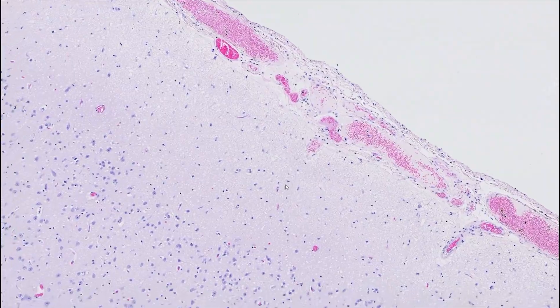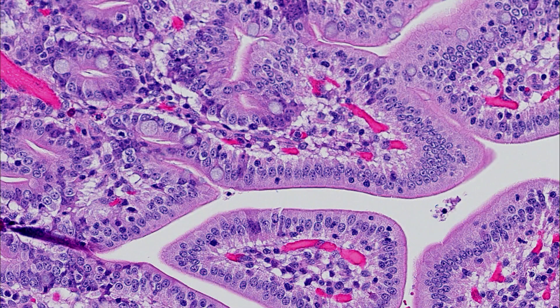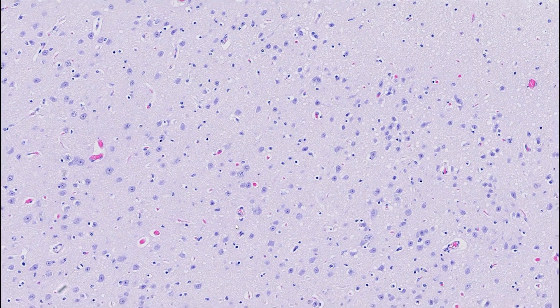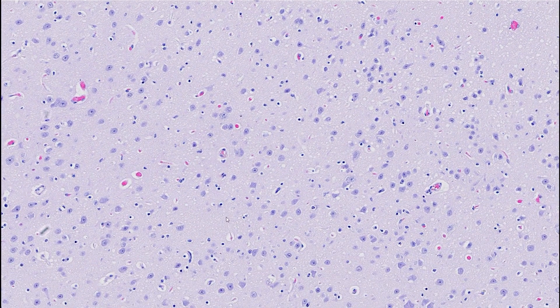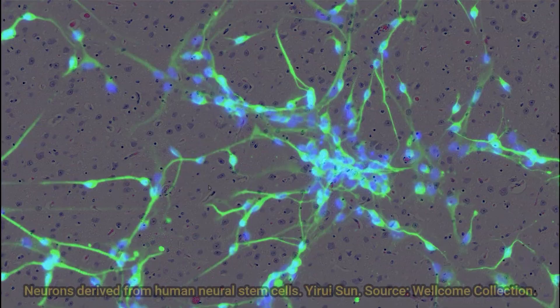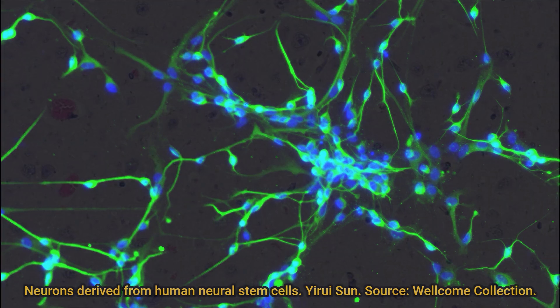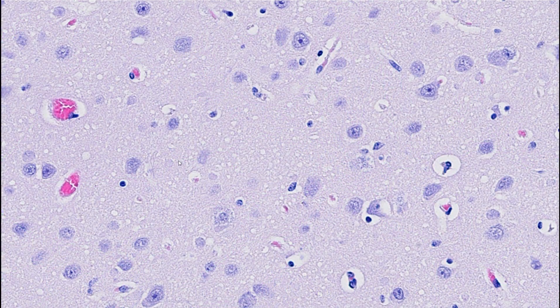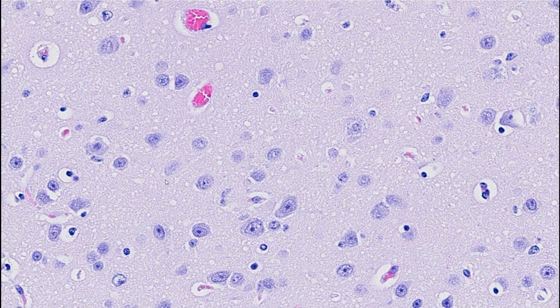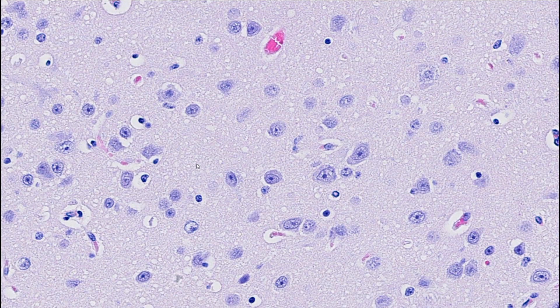Moving into the parenchyma it can be difficult to work out where the boundaries between cells are. In other organs you tend to have clearly defined structures, epithelial cells and other distinct features, whereas in the brain you're hit with a mass of pink and nuclei, which leads some pathologists to refer to the brain as the great pink wasteland, a relative desert of histologic detail. Most of the cells in the central nervous system have highly branched cytoplasm extending processes out to interact with other cells and structures. Most of what you can see as a pink mess is actually a fine mesh of these processes - dendrites and axons - too fine and intertwined for us to make out on standard stains. With the exception of neurons, all we can see is the cell nucleus, and all of this pink meshwork we refer to as the neuropil.